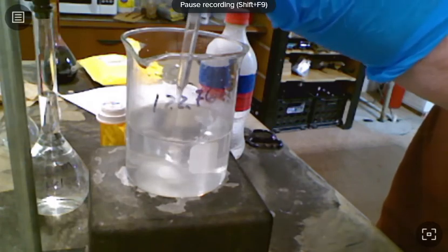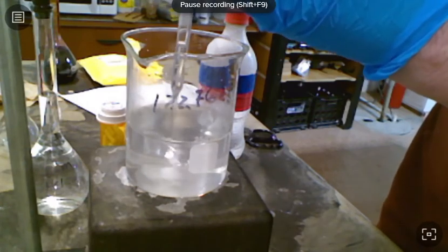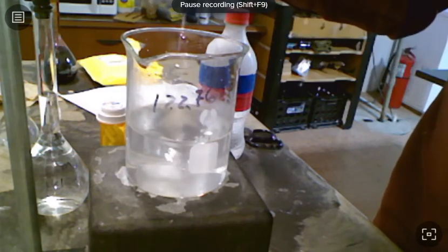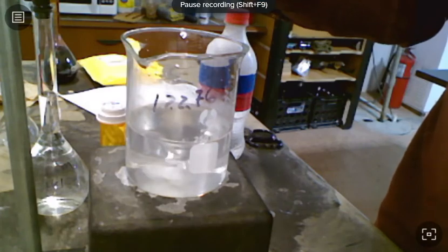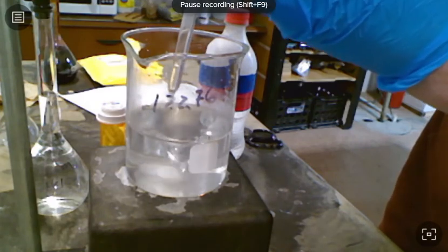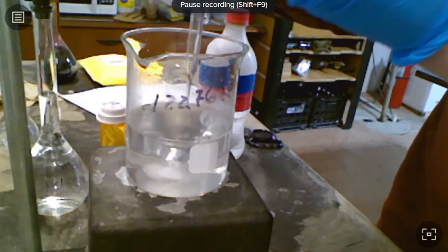Best I can, I want to get all of the sodium hydroxide that was in the cup out of the cup. I'm claiming that I put that much mass into my solution, and it's basically going to be that mass from which we're going to determine our molarity. So anyway, the point is we want to get that cup clean.